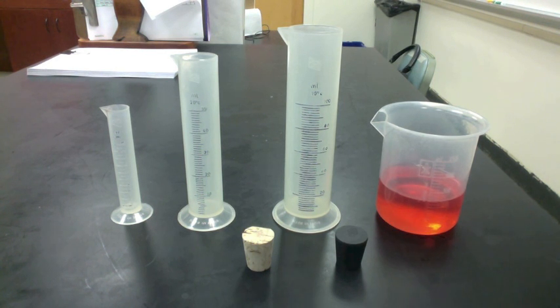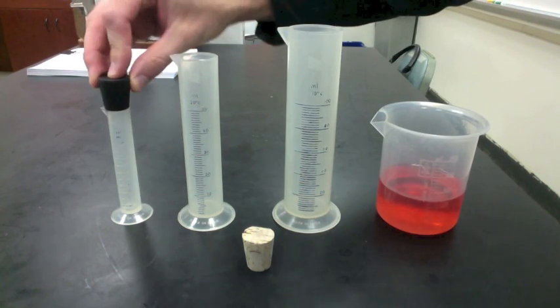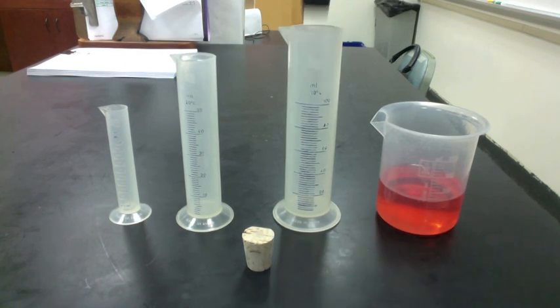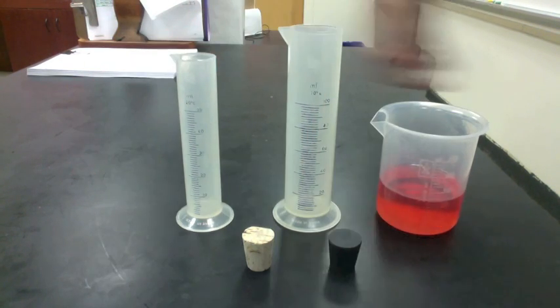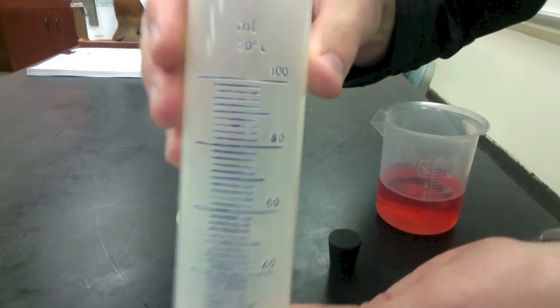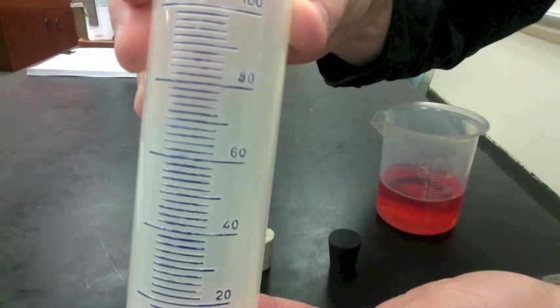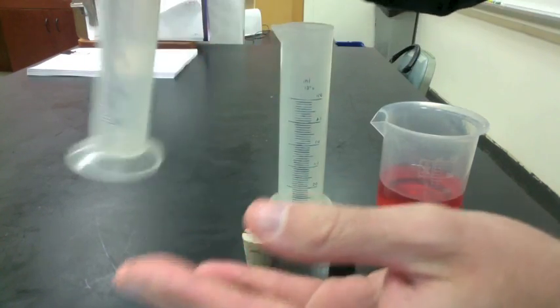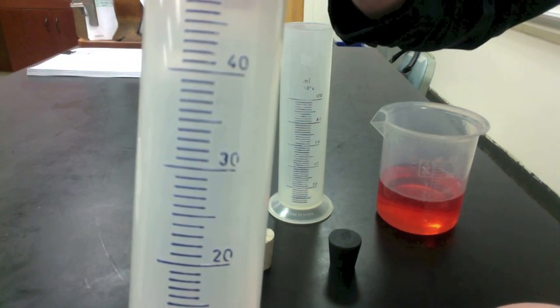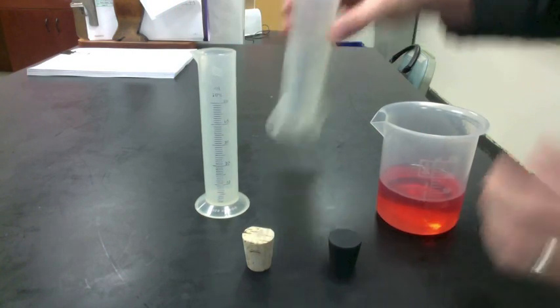To find the volume, we use a graduated cylinder. You want to use the most accurate one, but the object has to fit in it, so this 10 milliliter is no good. The 50 is good, and the 100 milliliter is good. Out of these two, we want the more accurate one. The scale on this one is 2 — to go up from 60 to 80, there are 10 lines, so each line is worth 2 milliliters. On the other one, to go up from 30 to 40, there are 10 lines, each line worth 1. So the 50 milliliter graduated cylinder is the more accurate graduated cylinder.